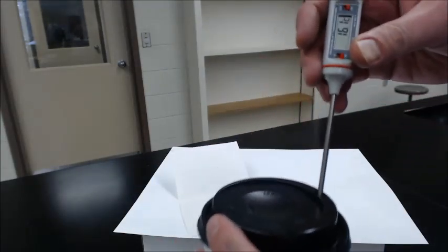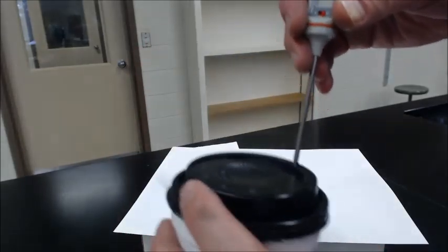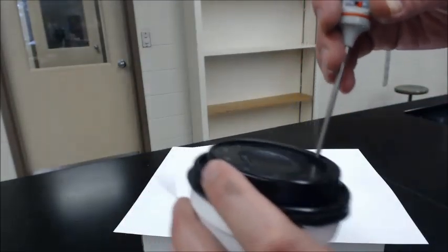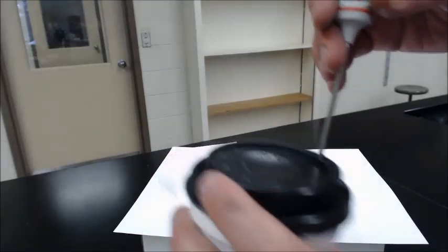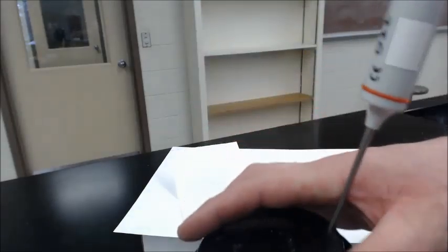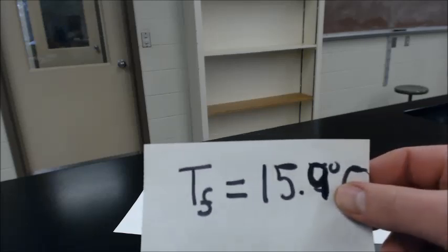We're down to 16.1, 16, 15.9. Lots of stirring, lots of swirling. Okay, this one's only going down to about 15.9 or so degrees. It got a little colder last time, but it's pretty cool. All right, so 15.9, and I check in there, and yep, it's all dissolved. And 15.9 was the lowest temperature that I had gotten to. So now we can use 15.9 as our final temperature.